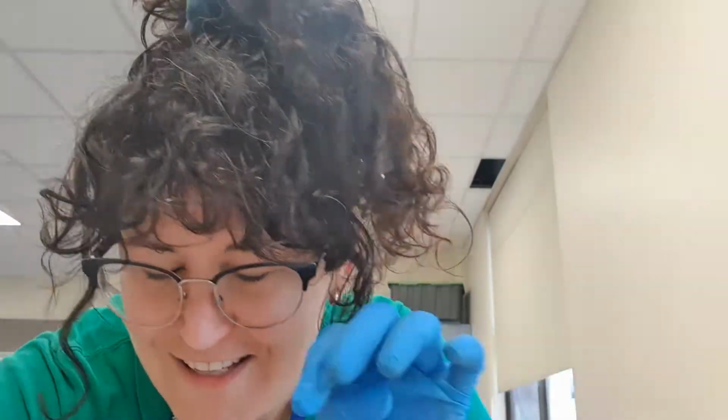I'm just going to add a little bit onto this experiment for fun, because you know, science is so fun. Because I've pulled them all out of their different temperatures, I'm going to let them sit there for another 5 minutes and see if we get any further reactions now that they're not at their different temperatures. Now that they're all sitting at room temperature, what do you think is going to happen? Do you think that there's going to be further reactions? Let's find out.